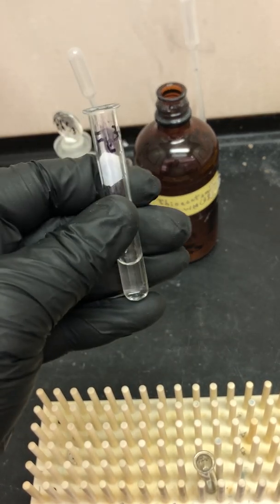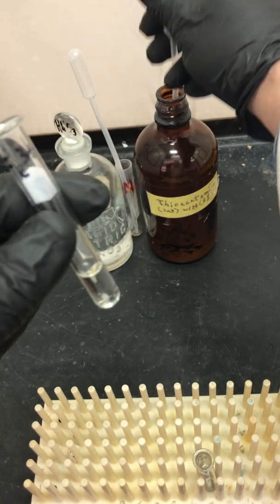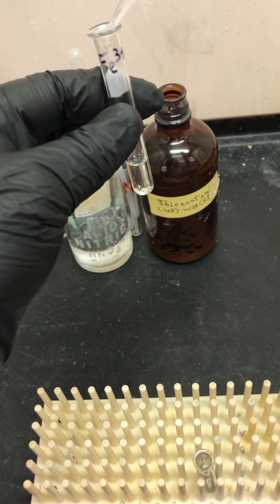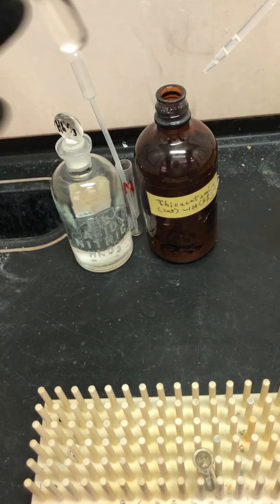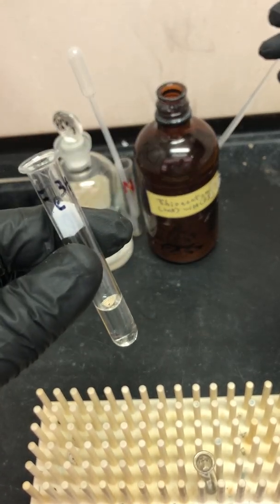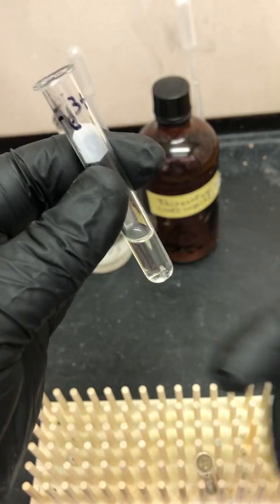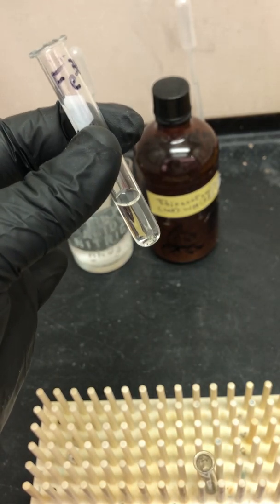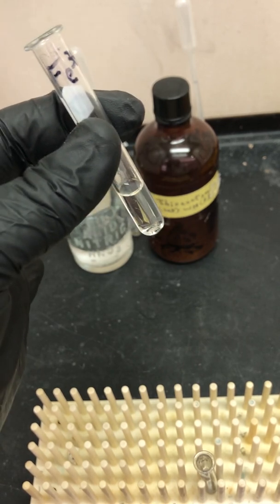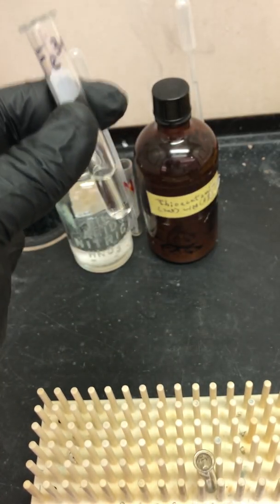I'm back at the fume hood. This is my supernatant of iron III ions. I do want to make sure that I got all the copper ions out, so I'm going to add a couple more drops of that thioacetamide — the sulfide producer — to make sure that nothing else precipitates. As you can see, it's okay. One thing that can happen is you might get a light or beige-colored precipitate, which in the chemistry of these reactions is sometimes elemental sulfur, precipitating as a yellowish-beige color. But as you can see, we don't have any precipitate here, so our iron III supernatant is ready for the next step.